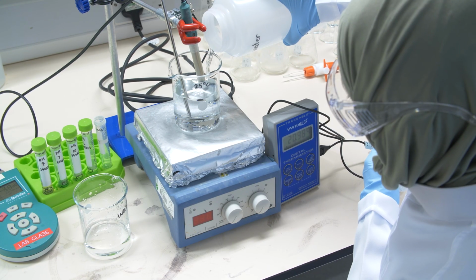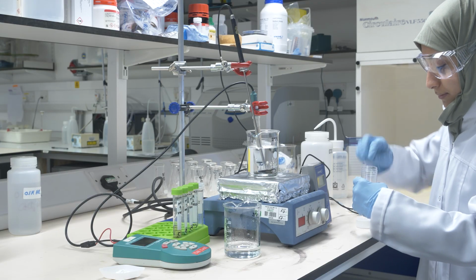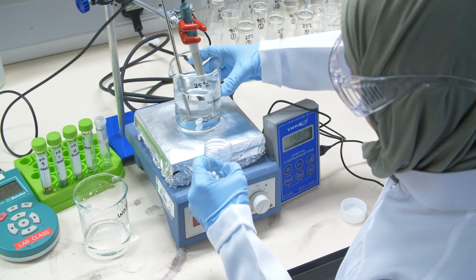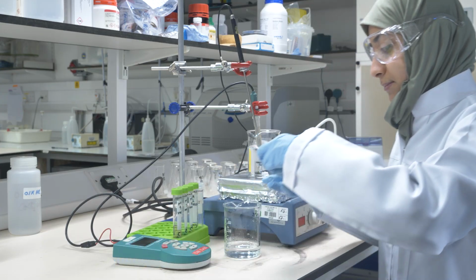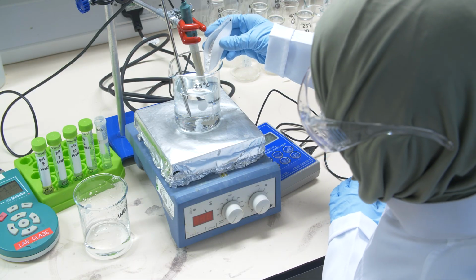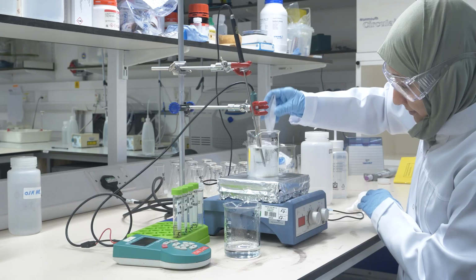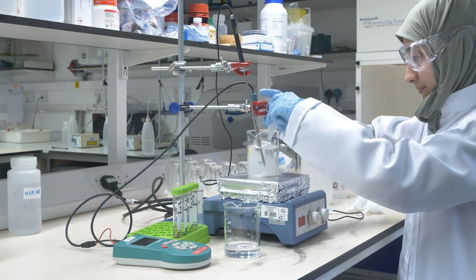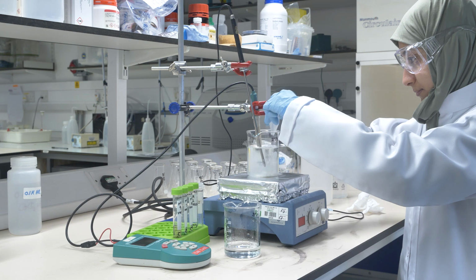Okay, so we make the first experiment at 25 degrees. We add the water, we add then the magnet which stirs our solution as we put in the calcium hydroxide. Now we put the calcium hydroxide, which we weighed out before, into the solution and stir it. Okay, the amount of calcium hydroxide doesn't have to be exactly known, it just has to be more than 2 grams, so that the calcium hydroxide is really in excess.